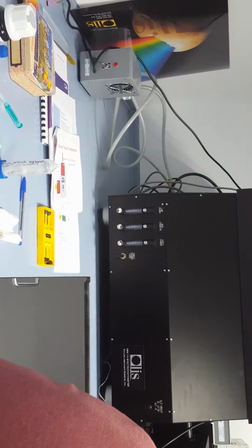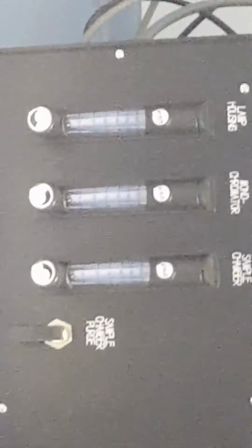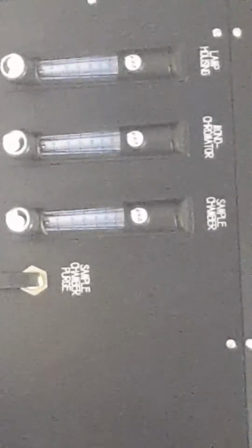So that's again on a day that someone wants to run it, and he's not going to be here working with it necessarily, just in and out of every hour or so and keep an eye on it. Now the further point, notice there are 3 valves on the left. The last one, the one on the right toward us most, is for the chamber. Now, the main one we want is the left one, which is the lamp. So we don't produce much ozone.